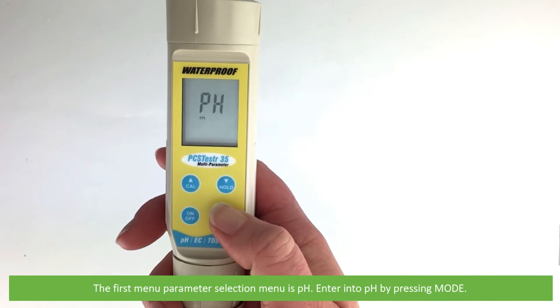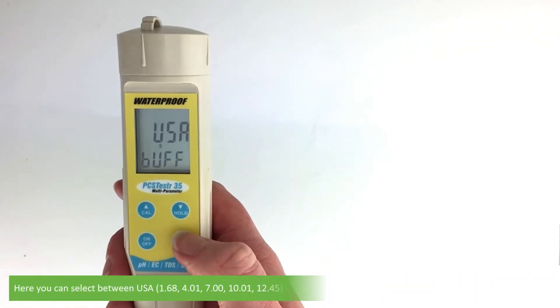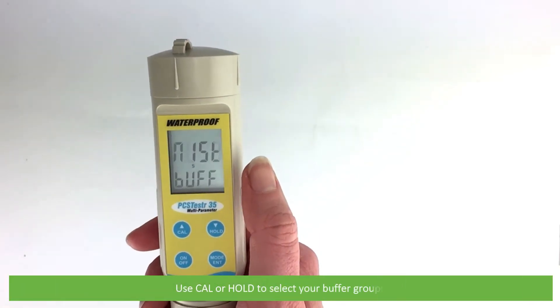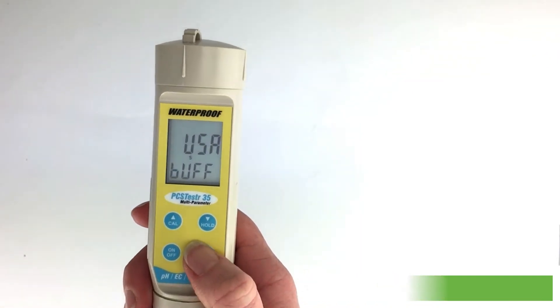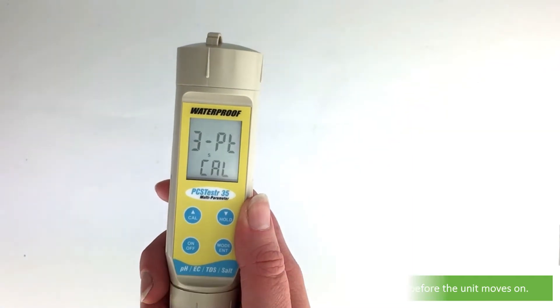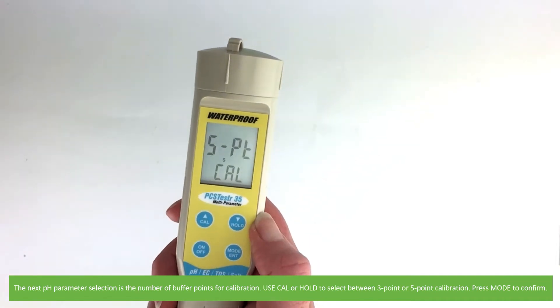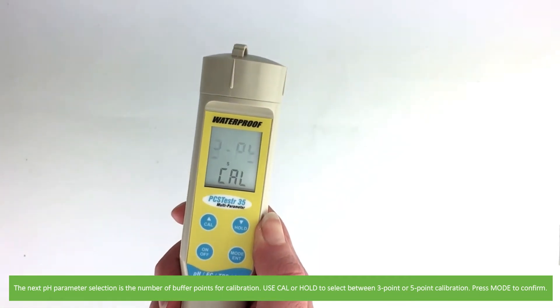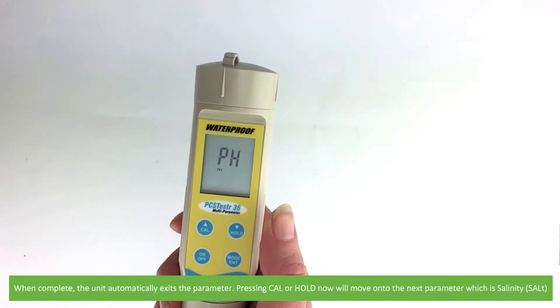The first menu parameter selection is pH. Enter into pH by pressing mode. Here you can select between USA or NIST calibration buffer groups. Use cal or hold to select your buffer group, and mode to confirm. Once confirmed, the chosen value will blink on the screen before the unit moves on. The next pH parameter selection is the number of buffer points for calibration. Use cal or hold to select between three or five point calibration, then press mode to confirm. Once complete, the unit automatically exits the parameter.